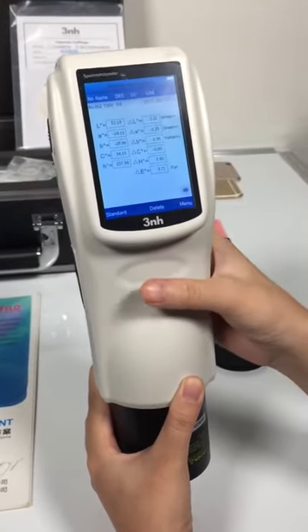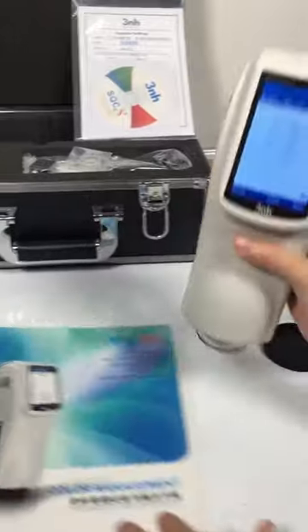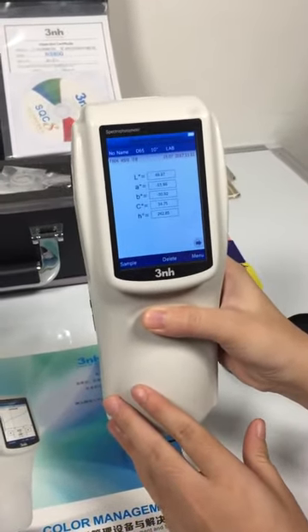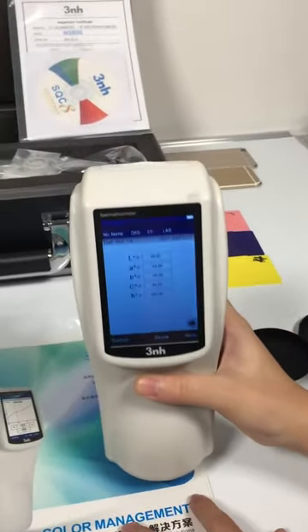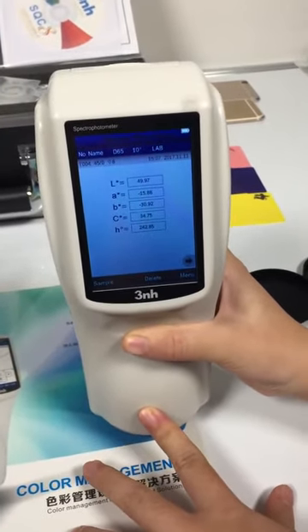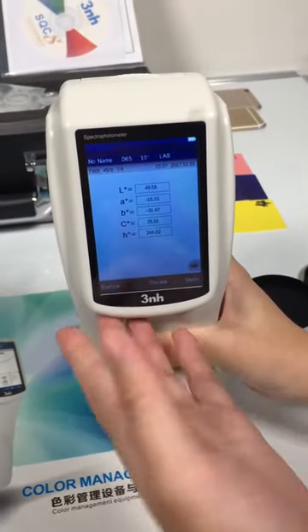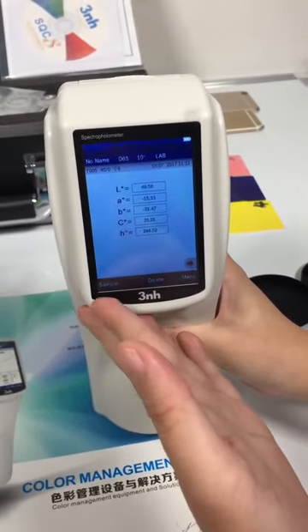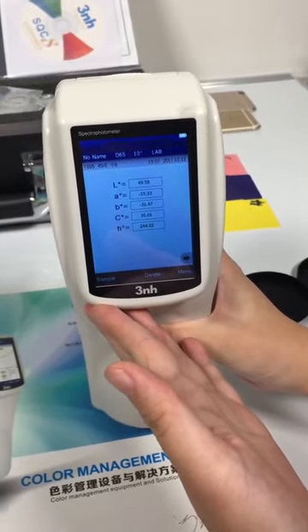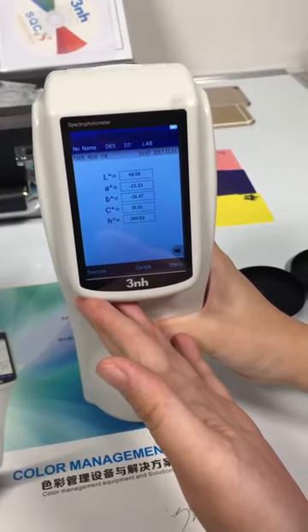Then we go back to the measuring. First, we made the standard measurements. We can see the data about LAB. L means white and black, A means red and green, and B means yellow and blue.